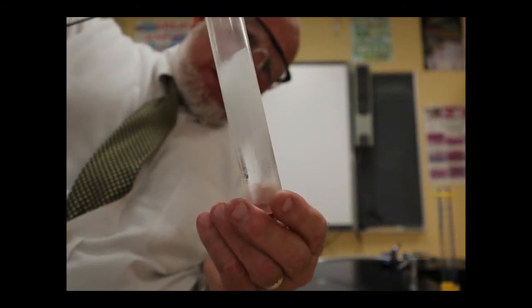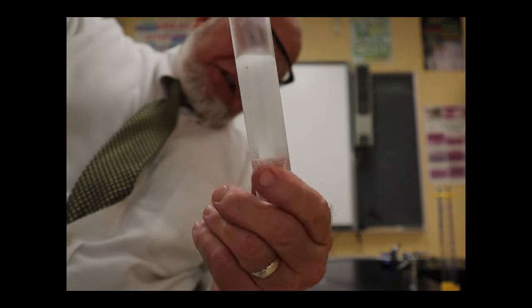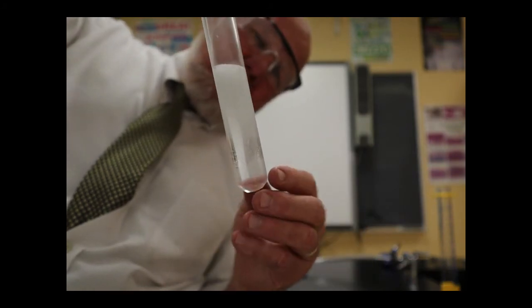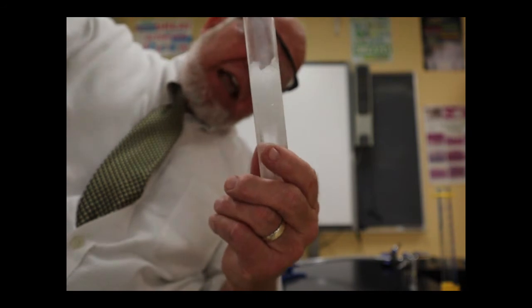So first time through, when you're doing an experiment, you make notes of things that could be better if you were to do it next time. And I'd strongly like to encourage you. We would probably do this 2 or 3 times, just so that we finally get the hang of it and we can get consistent results.